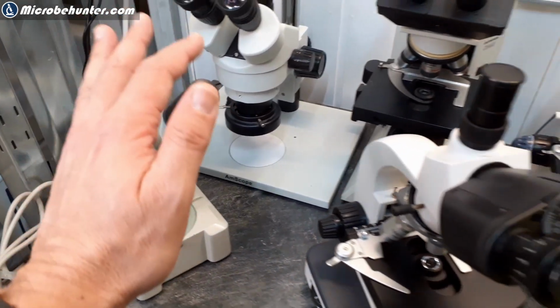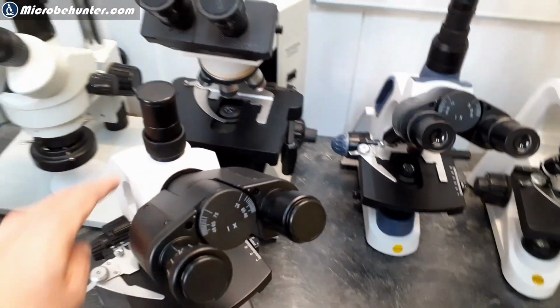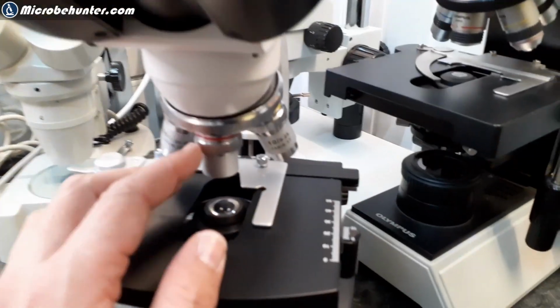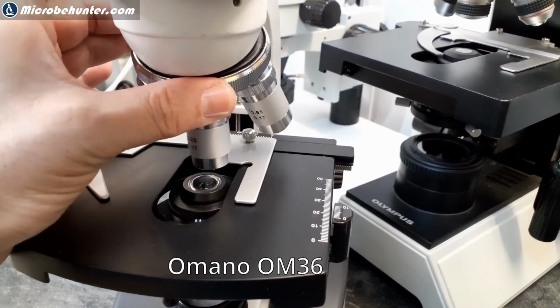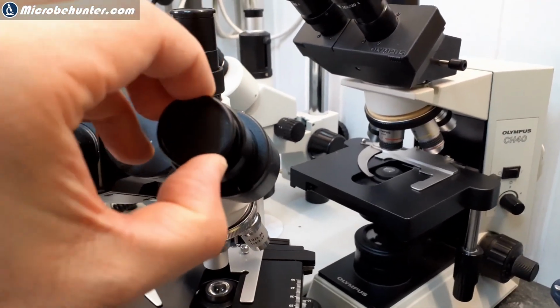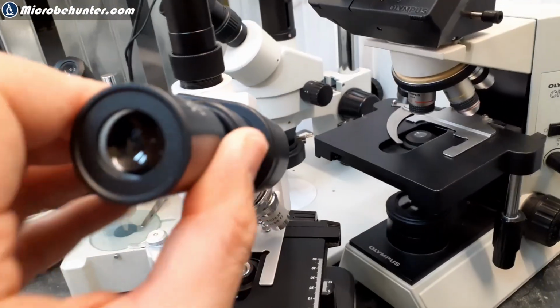Now let's go over here and have a look at some of those compound microscopes that I have here. All of them are fundamentally very similar in the sense that they have down here objectives of different magnification, which can also be adjusted here by rotating, and of course also eyepieces. Now, important is the following. I did not include any eyepieces here, so I'll take the one from over there and put it in here just so that you get the idea. Okay, here we go.